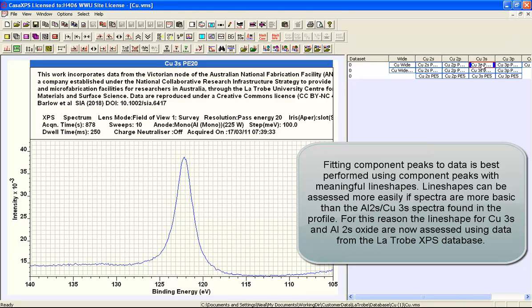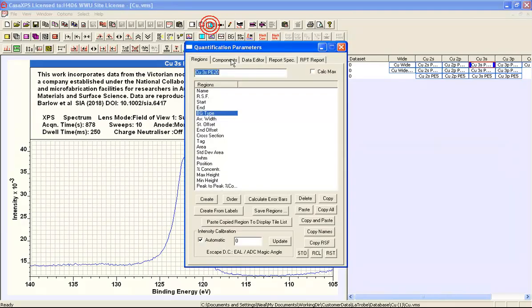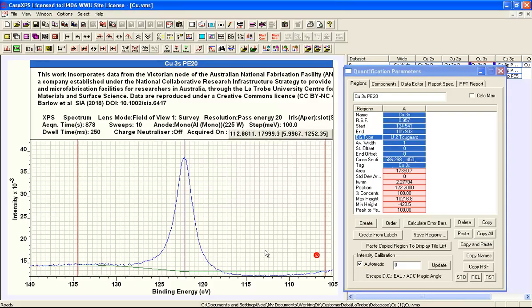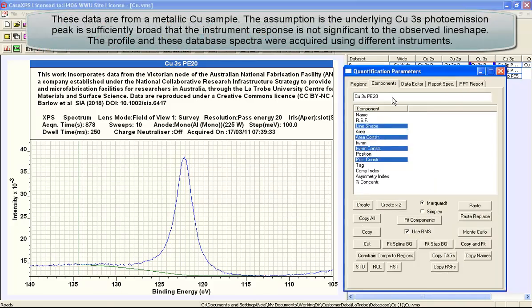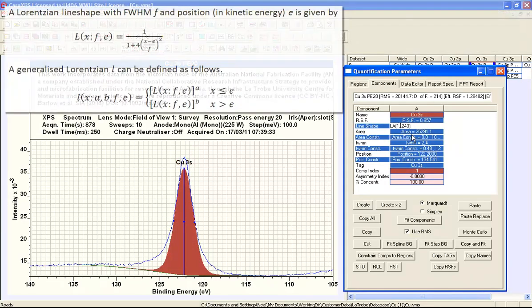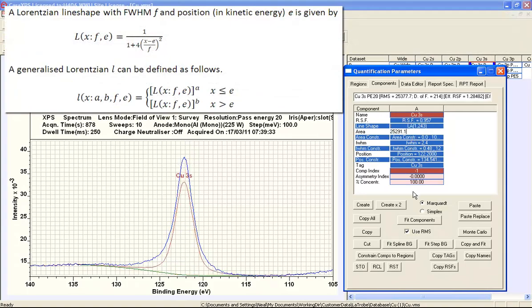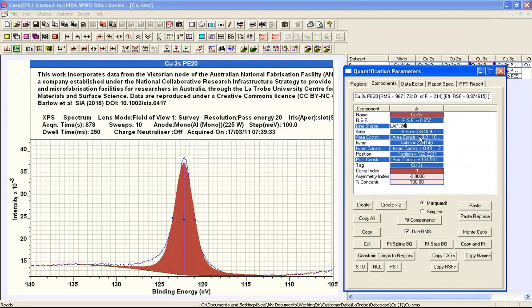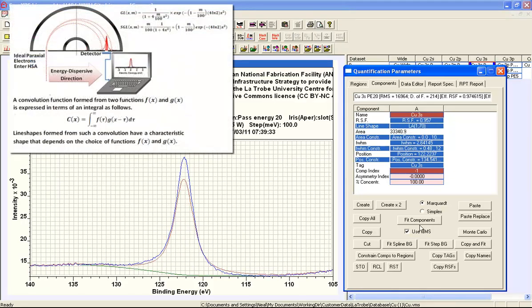So it's very useful to have data such as these that are from the Latrobe database that include a copper 3s as part of the data set, and we can see from these data that the line shape that appears as a consequence of the copper 3s is very Lorentzian. And we can get an idea of what this might look like if we introduce a line shape that is very Lorentzian, an LA 1,243. Let's try fitting these to the data, and then reducing the amount of Gaussian broadening. So now let's make that 70, say, and say fit.